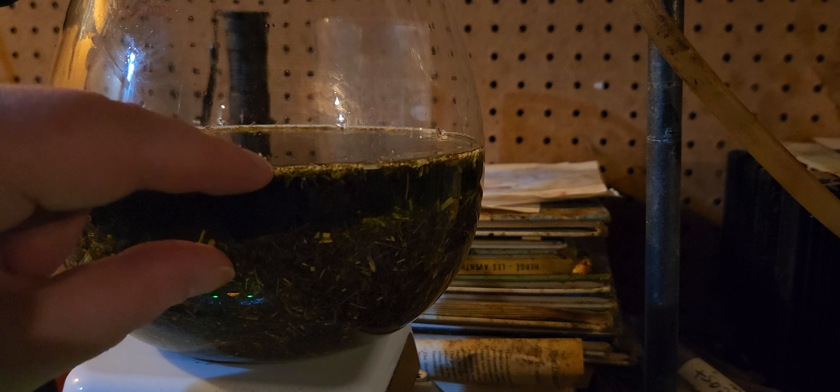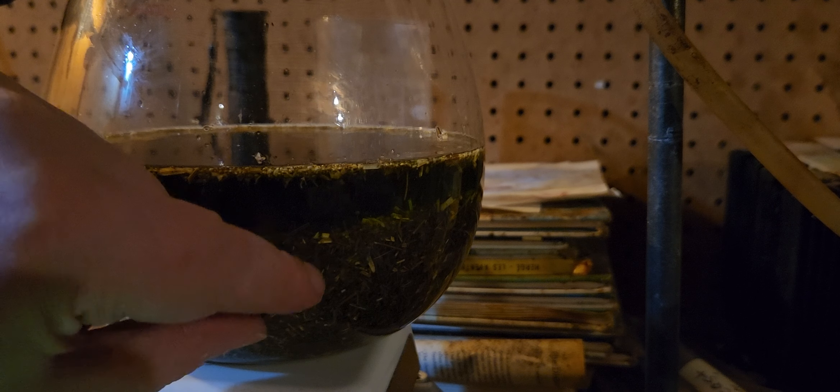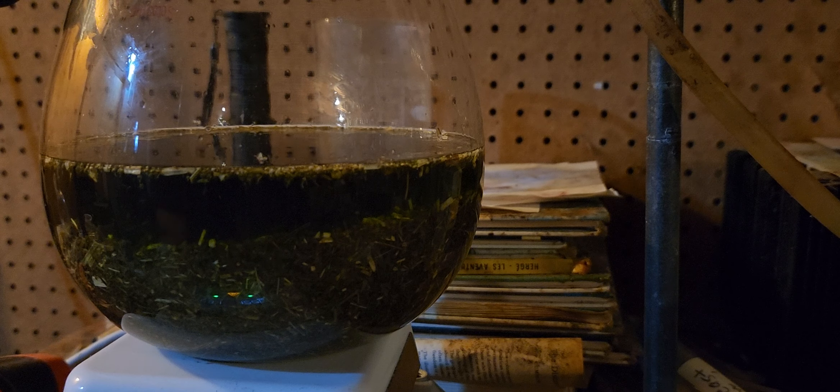As you can see, you'll probably lose a lot of the insecticide because the liquid will absorb into the leaves and you have to filter it with coffee filters and that kind of stuff without breaking them. So you might lose a lot of it — that's the only problem with it.